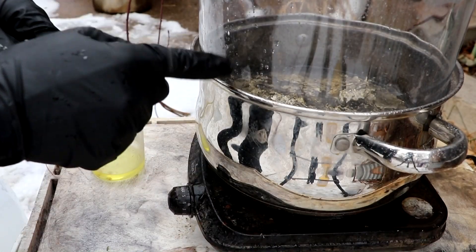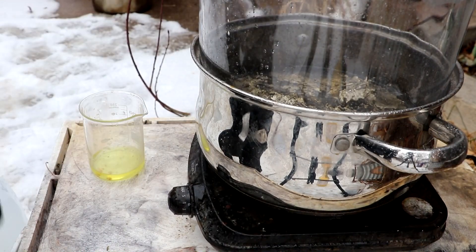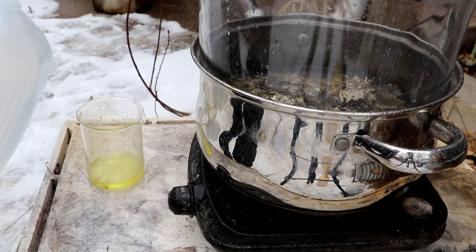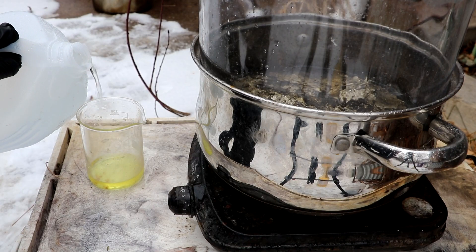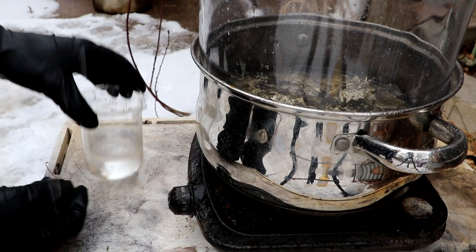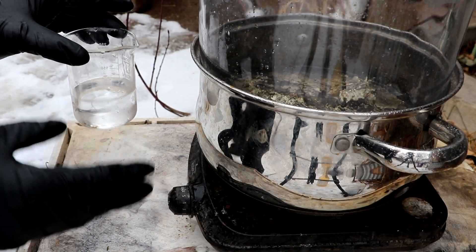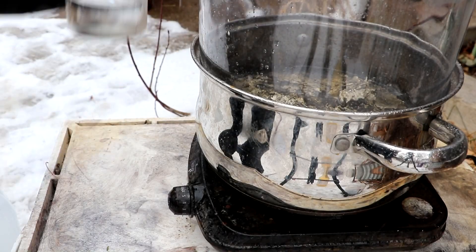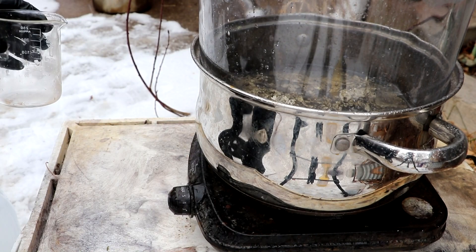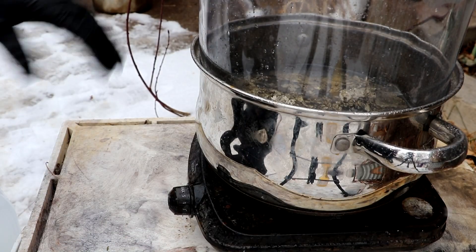I've got the silver and gold alloy spread out inside of this large jar to help minimize losses due to frothing. I have here some red fuming nitric acid — this is what I'll be using to dissolve the silver; the gold should be left behind. I'm going to dilute the acid with a little bit of distilled water to help dissolve the silver nitrate better and also slow down the reaction rate. It's pretty cold out here as evidenced by the snowing, but I've got it on this hot plate so it should warm up a little bit and the reaction will proceed at a more appreciable rate.